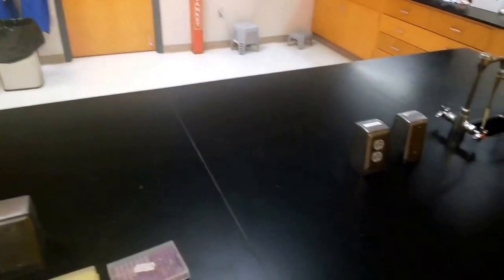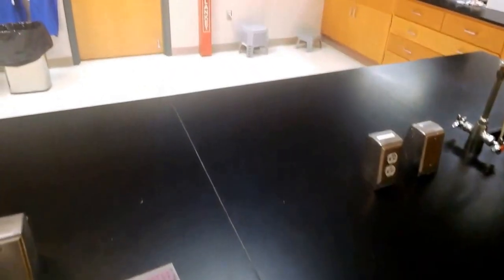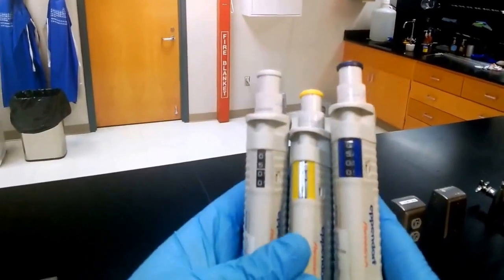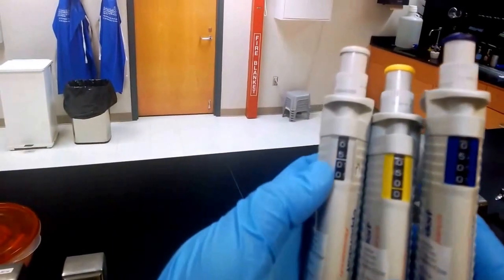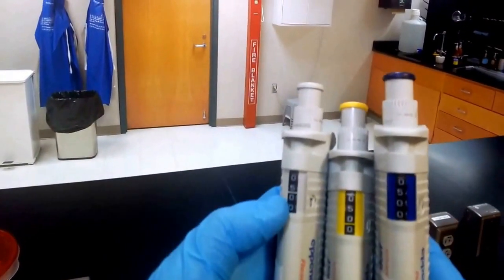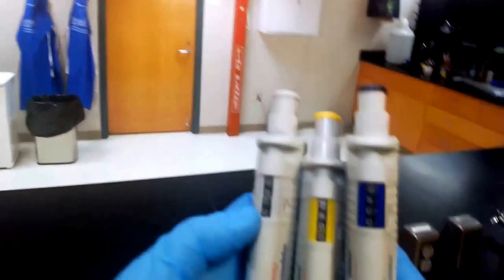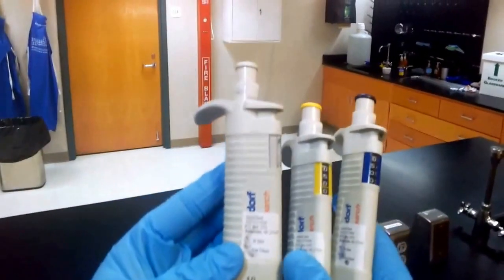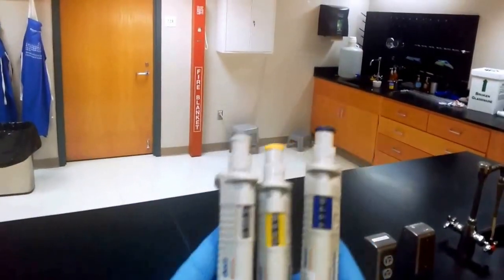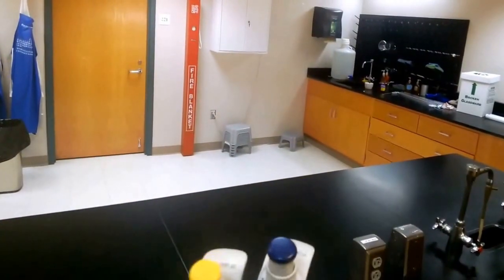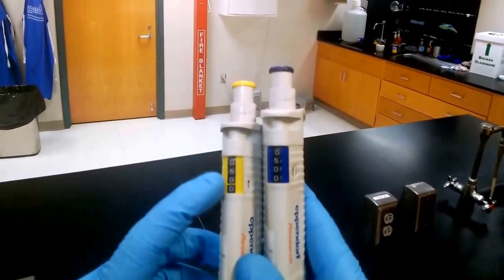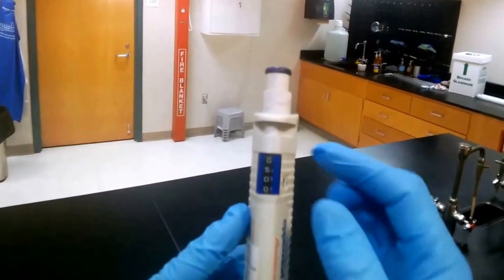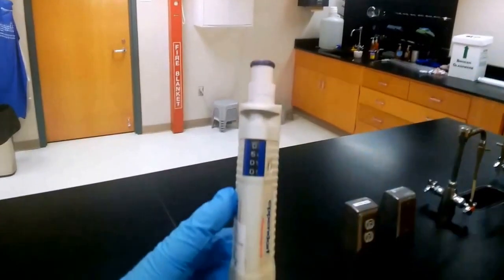Let's take a look at the Eppendorfs. The Eppendorfs, rather than using red and black numbers, they use little lines. For the 0.5 to 10 microliters, we have 0-5, then a line which is your decimal place, then two zeros. You can kind of see how accurate this is—if its accuracy is down to one hundredth of a microliter, that's pretty incredible. For the medium range, the 10 to 100 microliter, we've got 0-5-0 slash line 0, so that's 50 microliters. And for the big one we've got 0-5-0-0, so this means 500 microliters.